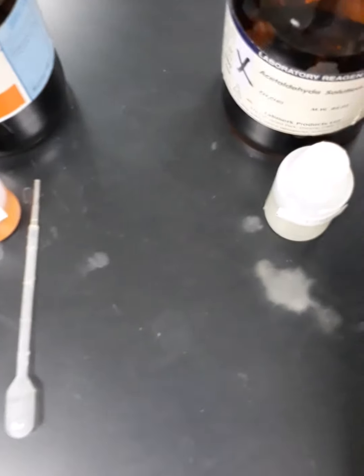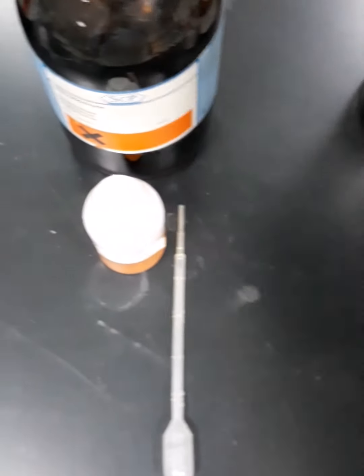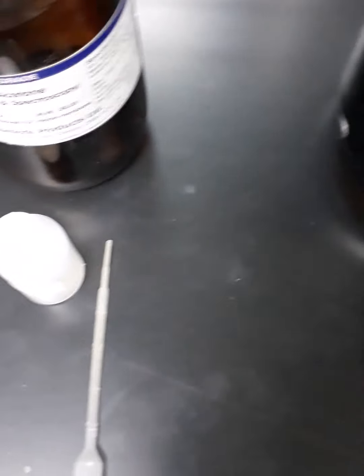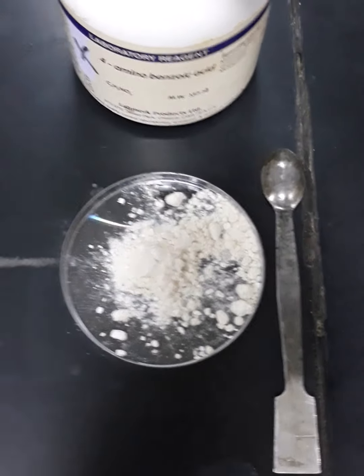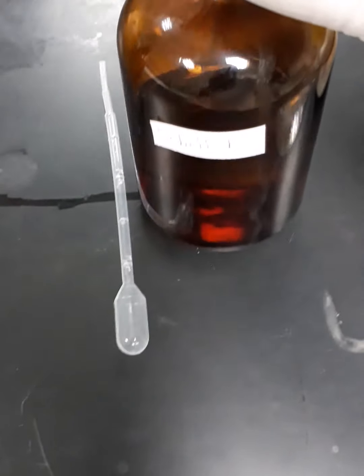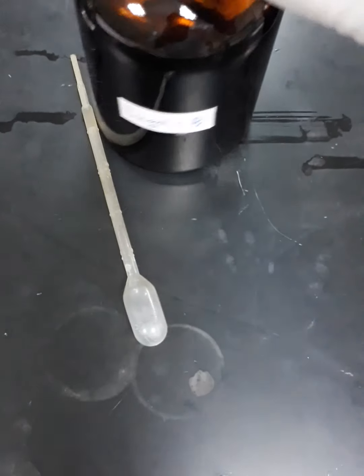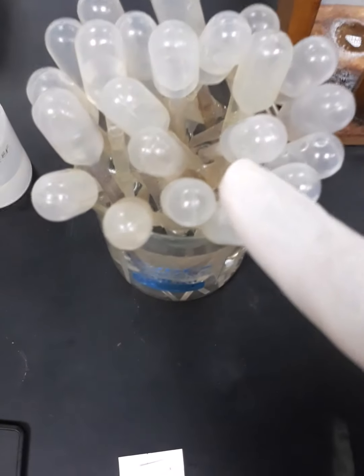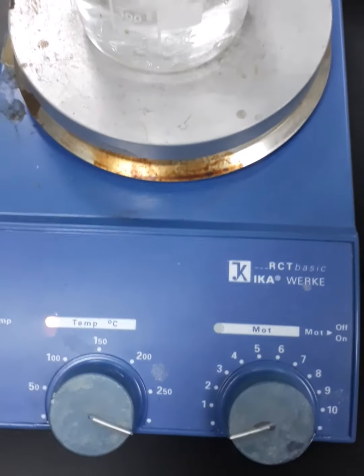We will start by having acetaldehyde sample solution, benzaldehyde sample solution, butanone sample solution, acetone sample solution, para-aminobenzoic acid sample powder, Schiff reagent, Lugol's reagent, which is iodine solution, sodium hydroxide 1 molar solution, test tubes of a capacity between 10 to 25 milliliters, in addition to the test tube rack, plastic droppers, labels, distilled water, and hot plates.